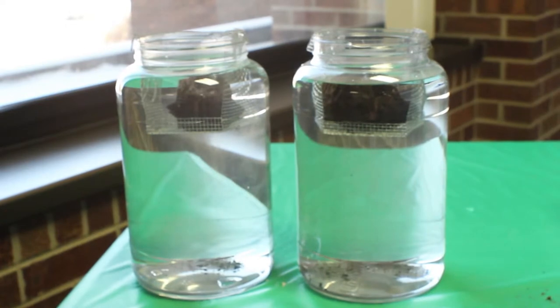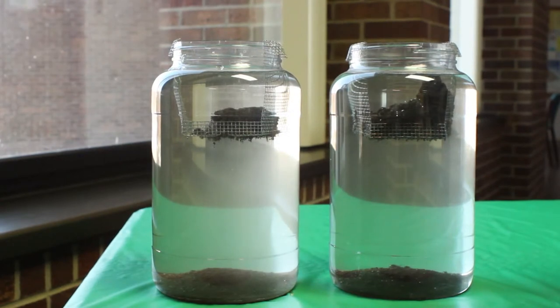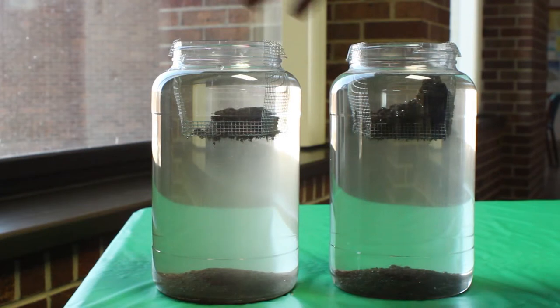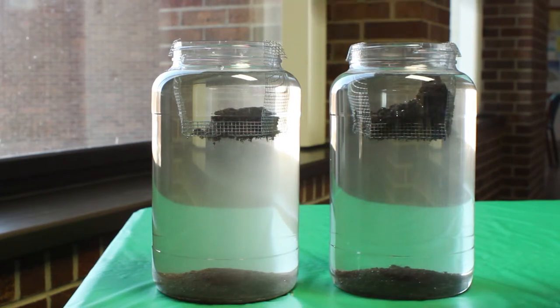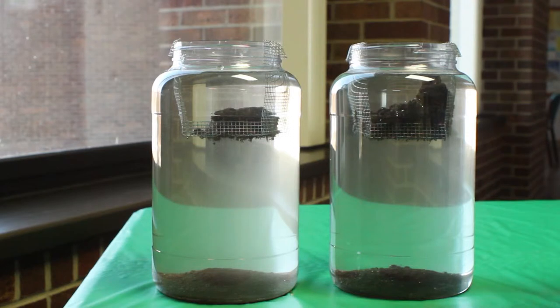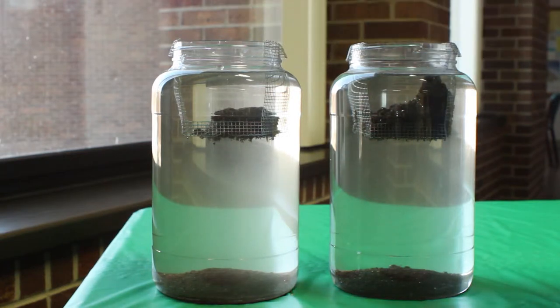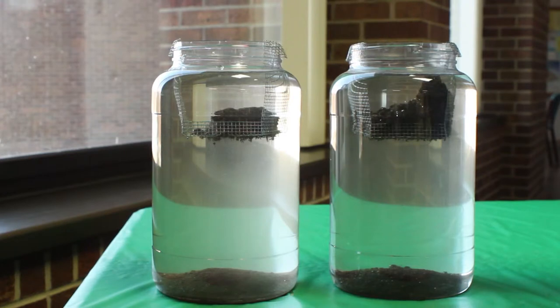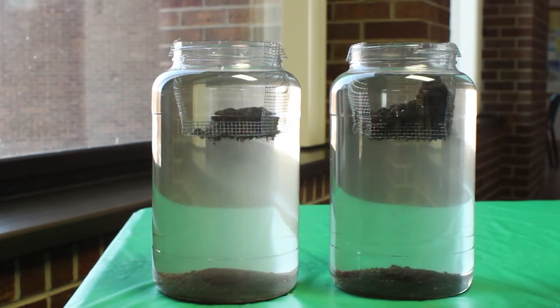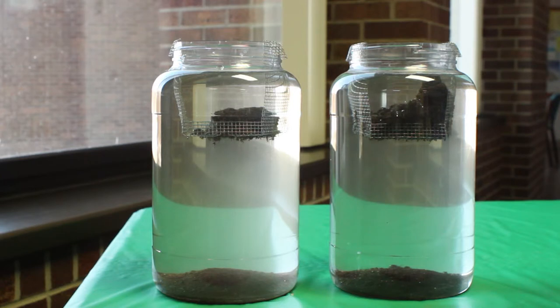After we've let this sit for a while, you can see some differences in clarity between the two samples. When looking at good samples for collection, if you look at conventionally tilled samples that were recently broke out of sod, they really won't show this demonstration very well. So we want to collect samples that have been conventionally tilled for long periods of time, so we can look at those that have poor aggregate stability. Those differences will show up as clarity differences within our samples, and you may need to let it run for a few minutes before you really start to see them. Picking out your samples is really important within this demonstration.